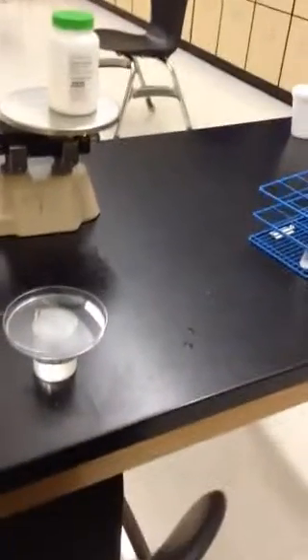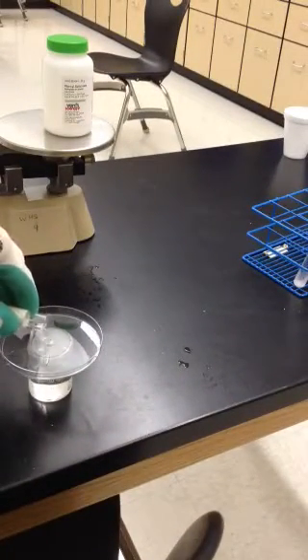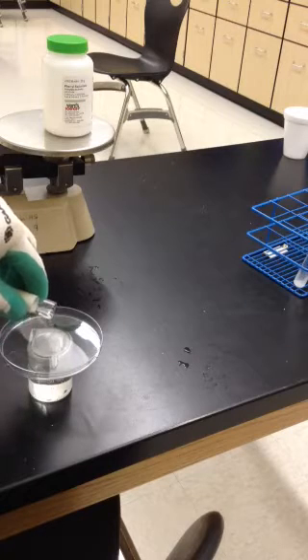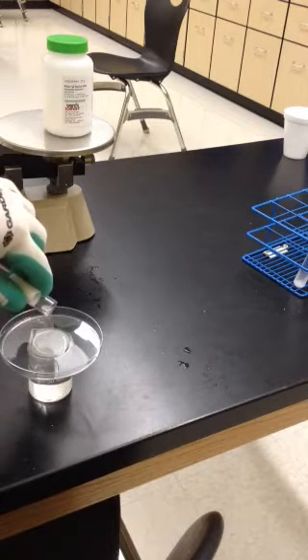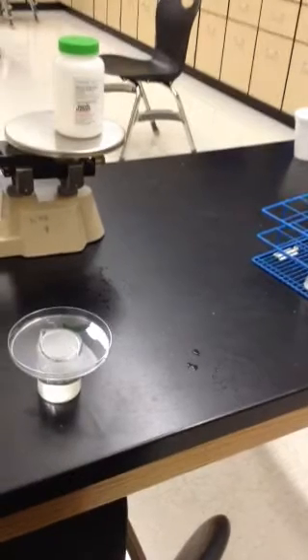So imagine this being like, oh no, Hawaii, where the rock is crystallizing around lava, which is hot, right? So we'll see how long it takes to crystallize and what the crystals look like afterwards.